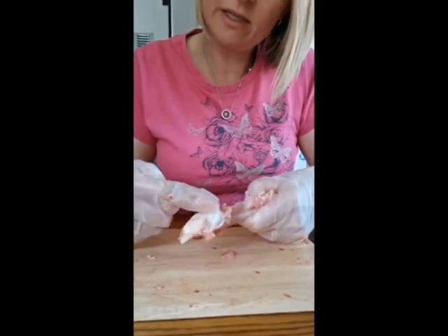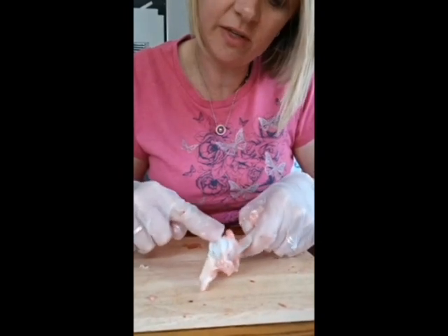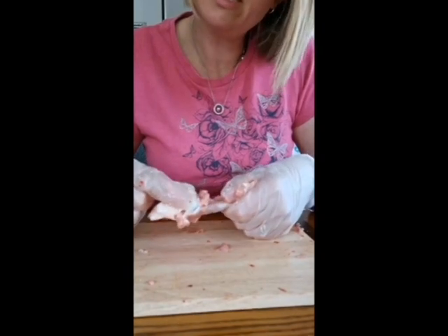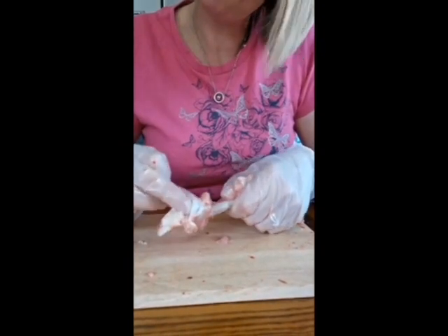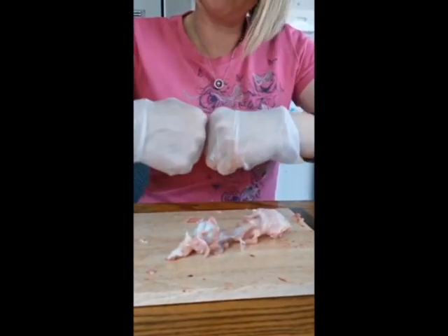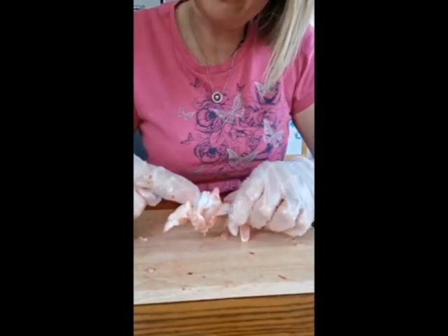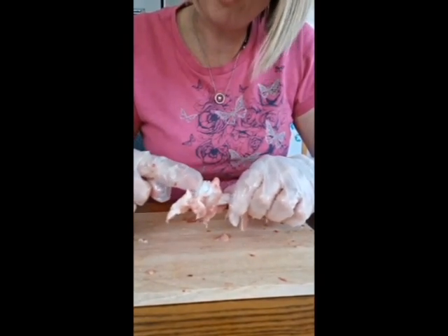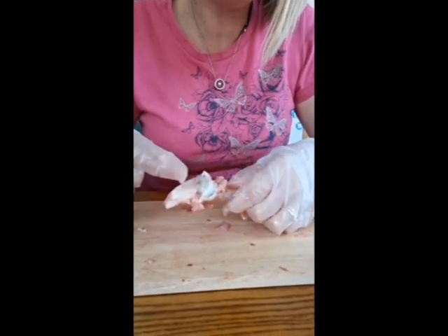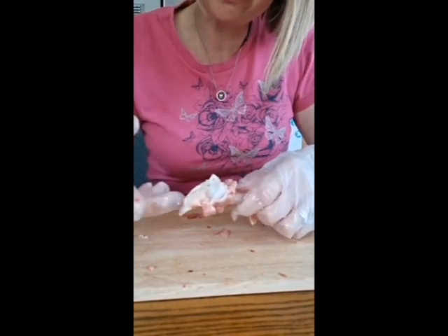See how it's white? And it's got a different kind of texture to it. You can feel it, I don't know if you can see it, compared to this part of the bone here. This is a bit more rubbery at the end. The rubbery bit, the white bit, is the cartilage. So when the bones are rubbing together as the chicken was moving its leg, the job of the cartilage is to protect the bones so that they don't rub away and wear away at each other. So that's the cartilage. So hopefully you've enjoyed this dissection. You've seen the cartilage, the ligaments and the tendon and the muscles as well as the bone.